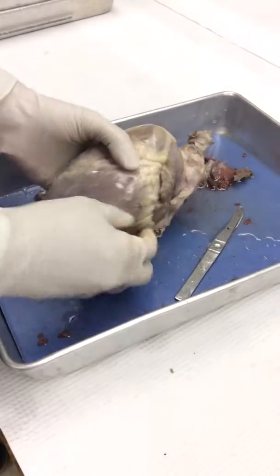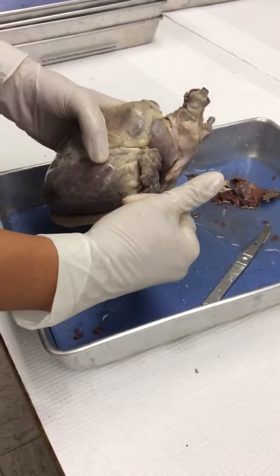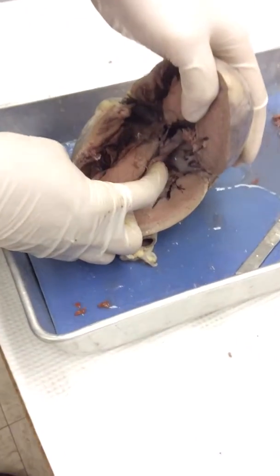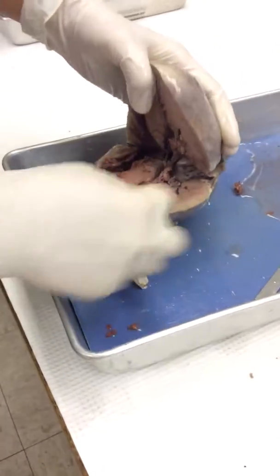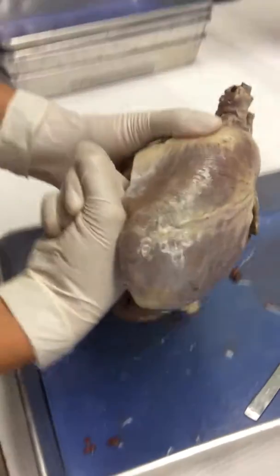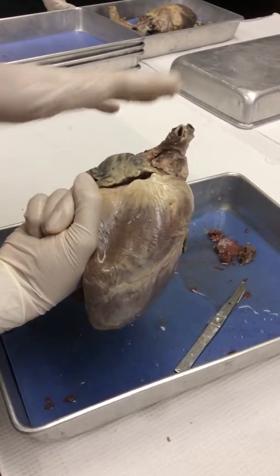So it leaves through the pulmonary arteries, comes back in through the pulmonary veins, goes through the left atrium, through the bicuspid. See right here, 1 cusp, 2 cusps, through the left atrium to the left ventricle, and then back out through the aorta. Here's the ventricle right here, and if you follow my finger, now I'm in the aorta. Does that make sense? So now the blood goes up out of the aorta to the rest of the body and gives oxygen to all the tissues.